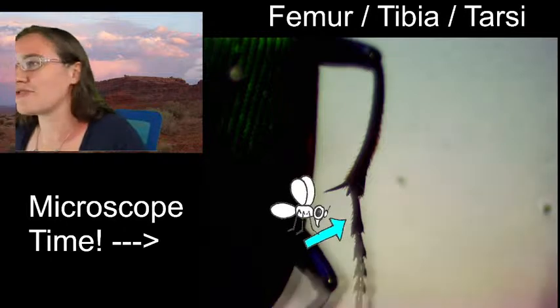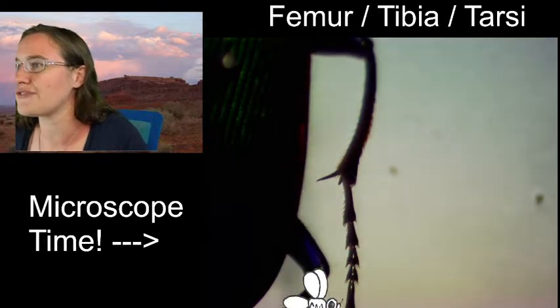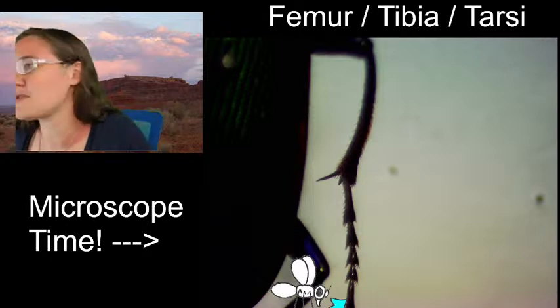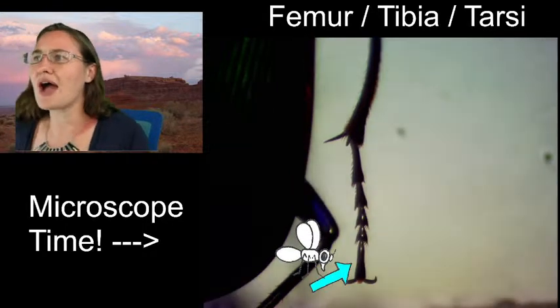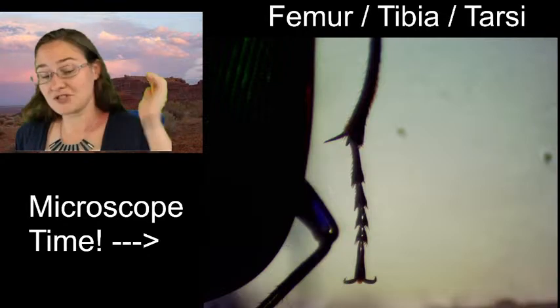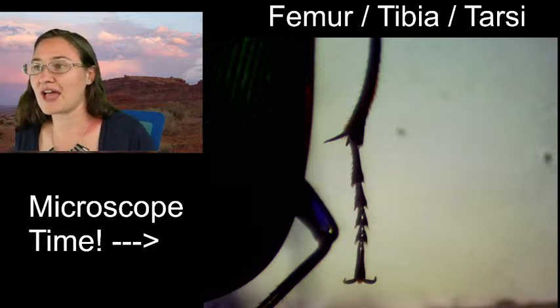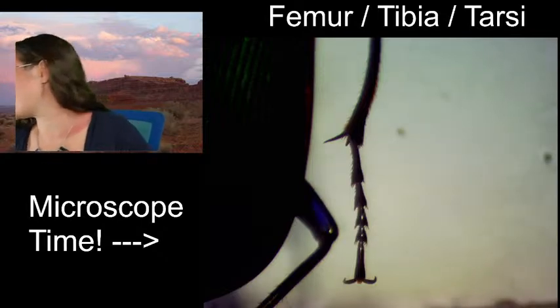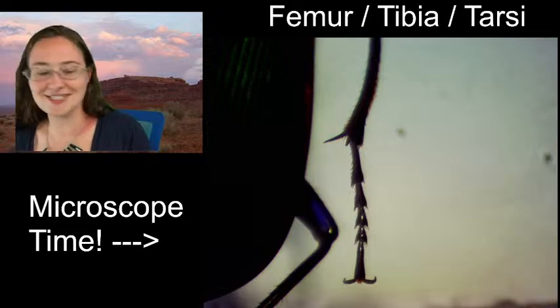And then, if we were going to count the tarsal segments, 1, 2, 3, 4, I believe this is going to be the last one, 5. Yes. So our beetle has 5 tarsal segments on the front leg, 5 tarsal segments on the middle leg, and we'll look and see what it has on the hind leg after we get this sketch done.